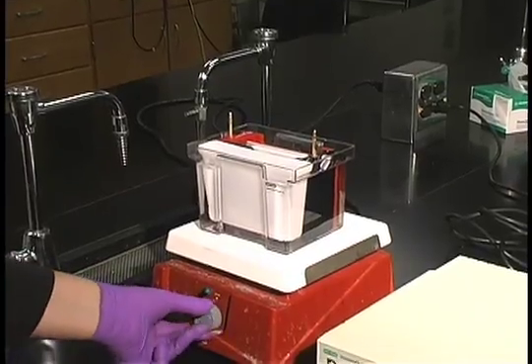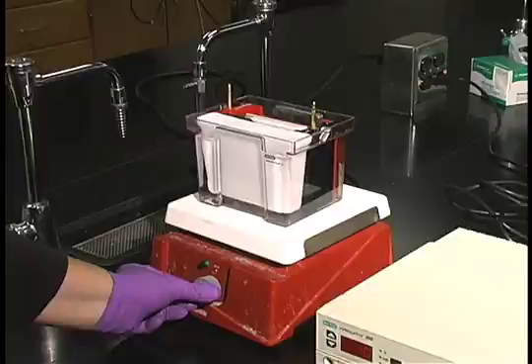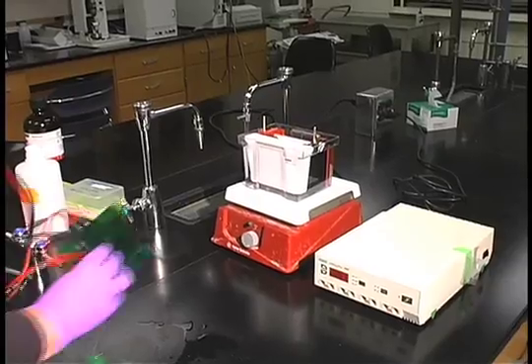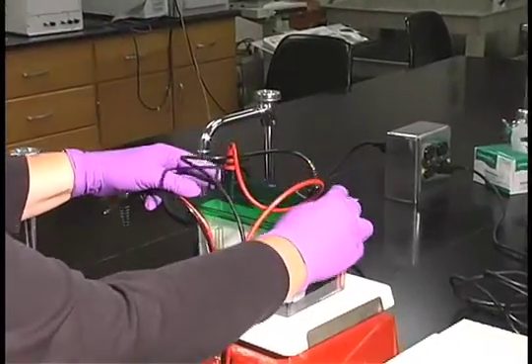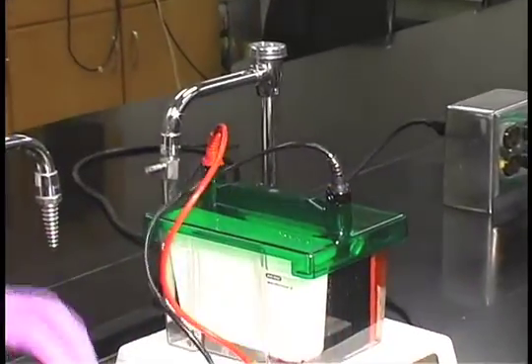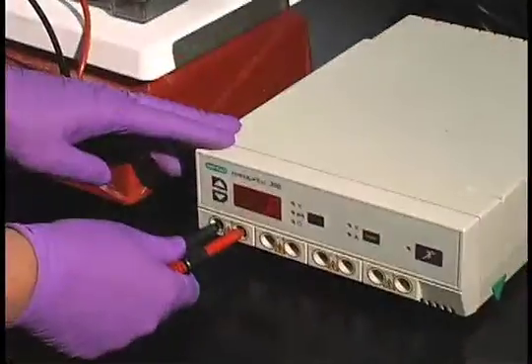Turn on the stir plate. Then attach your cover with the leads. Remember red on red, black on black. And connect them to your power supply.